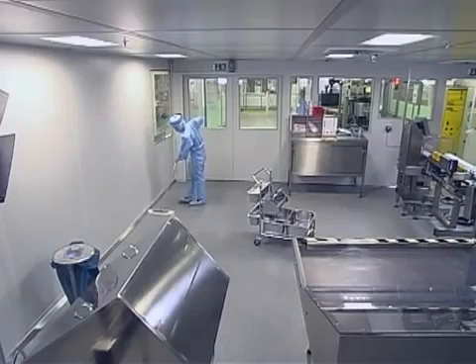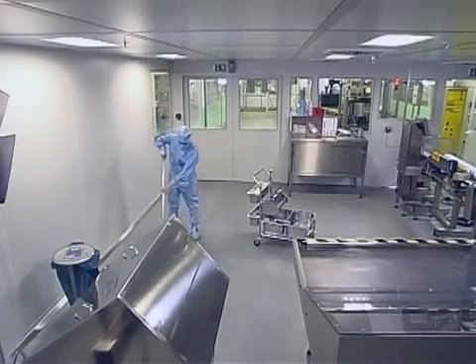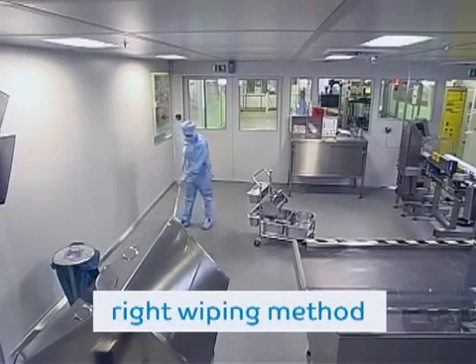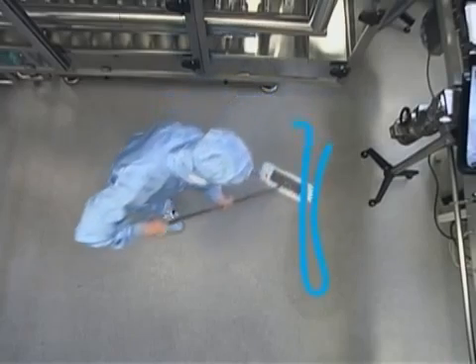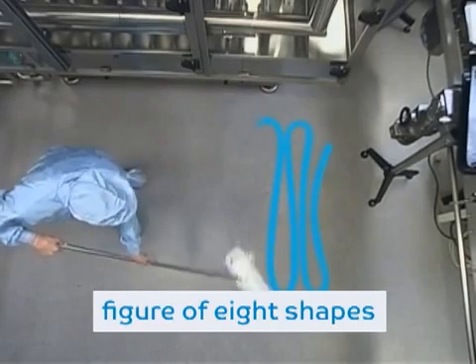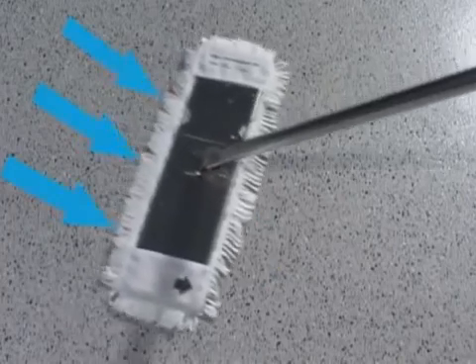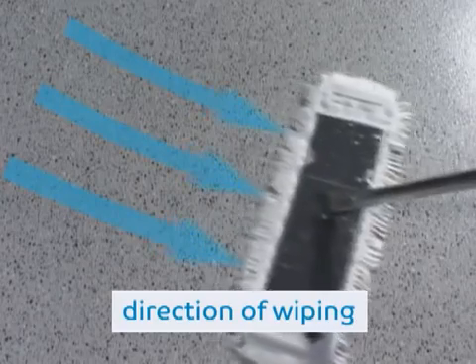Now you can start wiping, not randomly, but according to a very special technique exclusively developed for clean rooms. All surfaces such as floors or walls are cleaned with the so-called figures of 8 method. For this purpose, move the mop in 8-shaped loops over the floor while moving backwards. Always move towards one wipe direction only. This way you prevent dirt particles and pathogens from being left over.